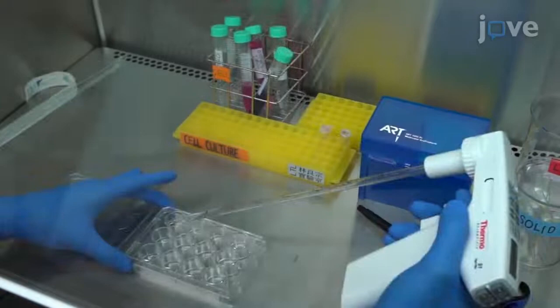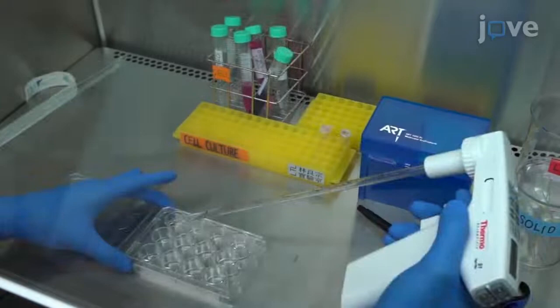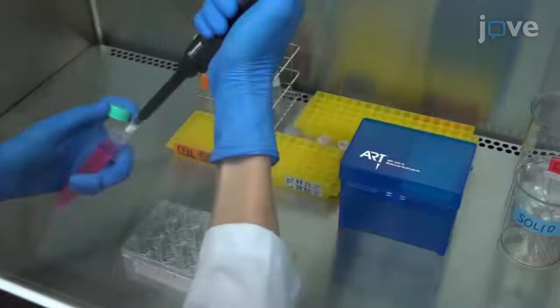At the end of the infection incubation, wash the cells with PBS and overlay the cells with 1 mL of fresh basal medium containing 0.8% methylcellulose.